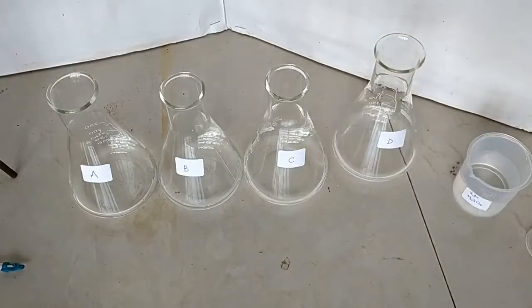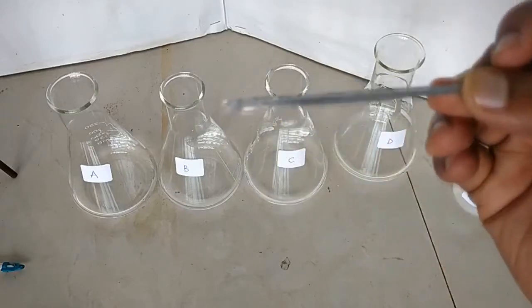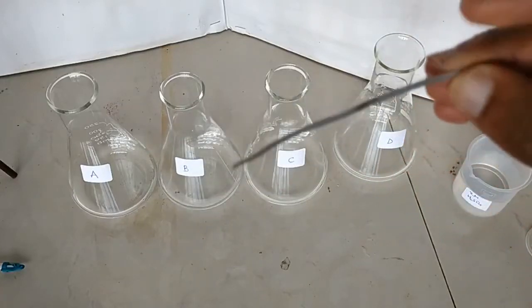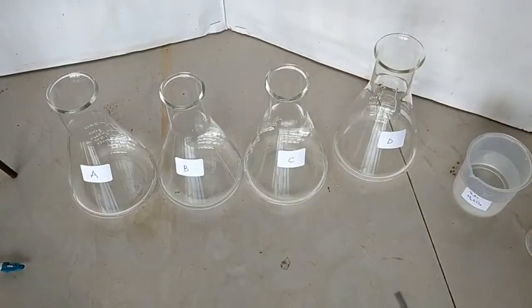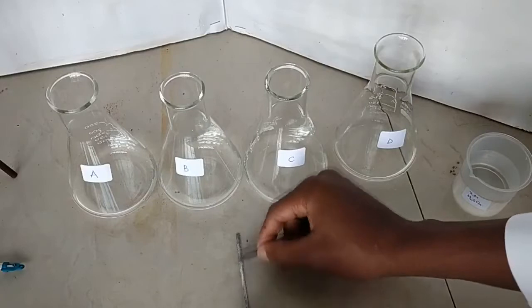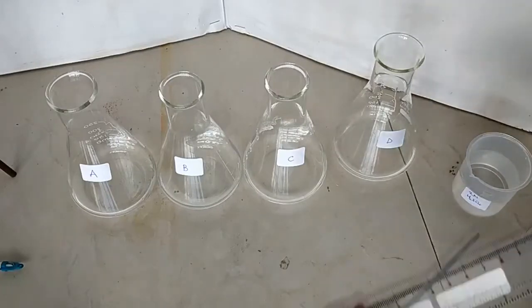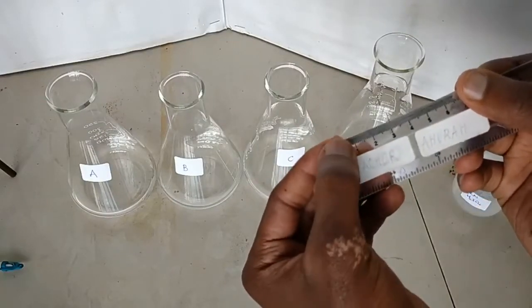Now I want to see how the sulfuric acid reacts with this magnesium ribbon. You can see it has a coating — a dark gray solid on top — that is magnesium oxide, because magnesium is a fairly reactive metal and reacts with oxygen in air to form an oxide layer. I'm going to scratch off the oxide layer until it's gone. Now I have a fairly clean piece of magnesium ribbon, and I'll measure about 2 centimeters using my ruler.